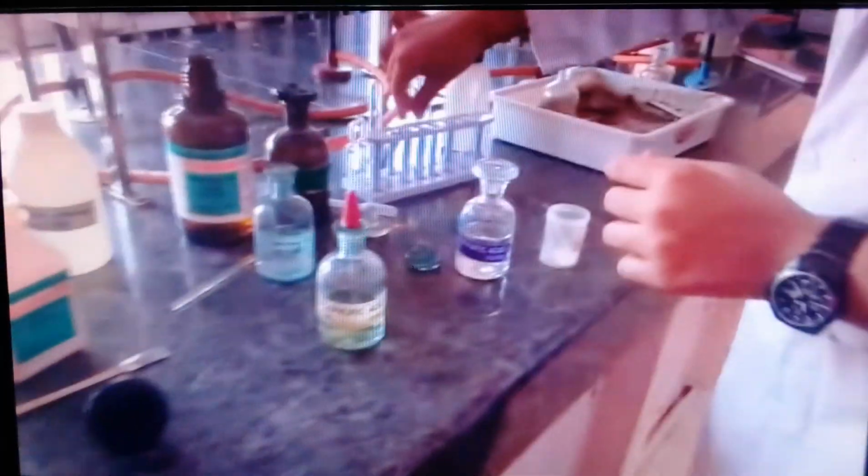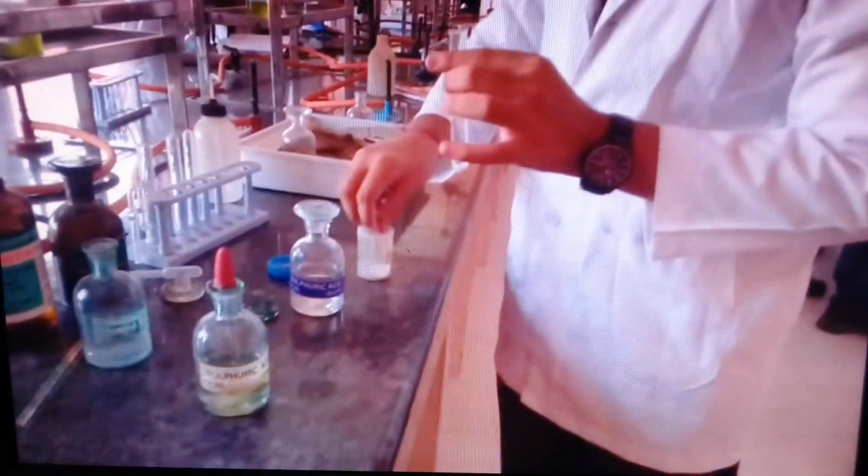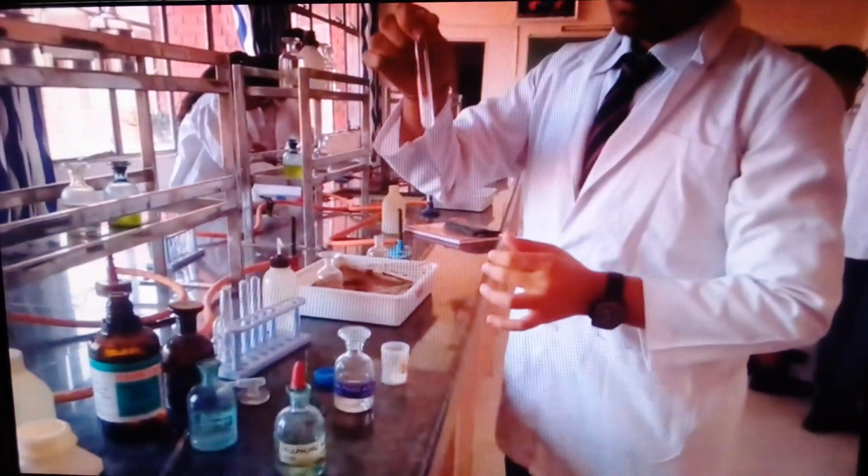Moving ahead, moving to the confirmatory test of chloride, we'll discard the contents and use the original solution. In some books, it's written as water extract. What do we mean by the original solution? Original solution means salt plus water. Make the original solution. Take a pinch of salt. Add water to it. Shake it to dissolve it completely. Once your original solution is ready, add a little more of water.